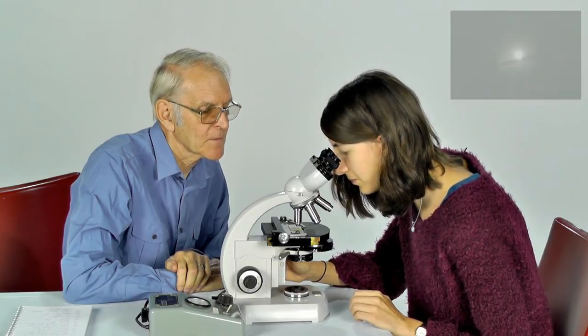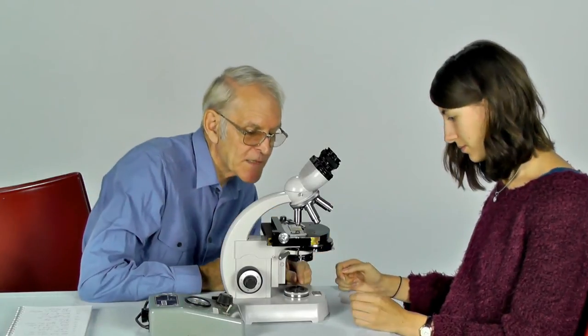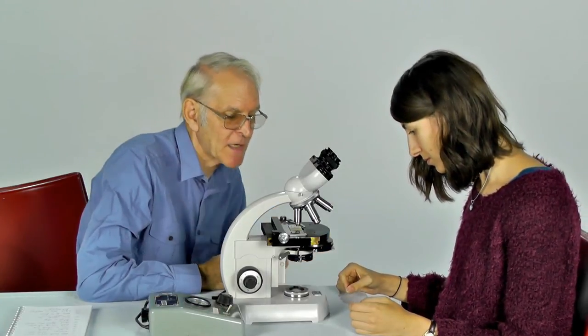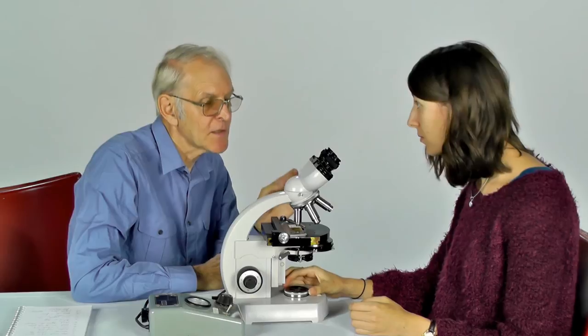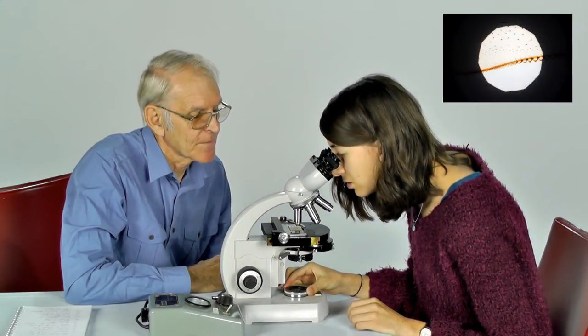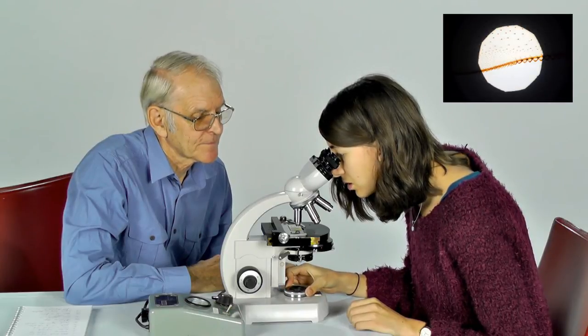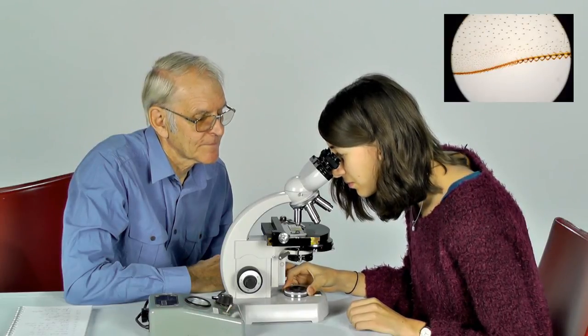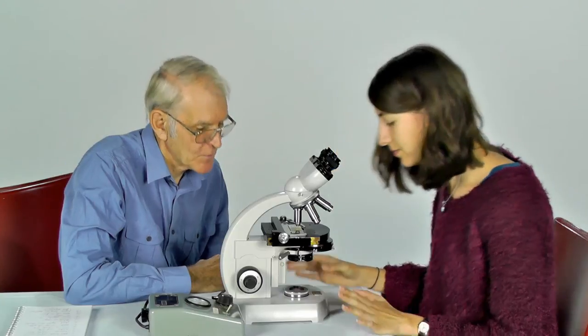Now it's a matter of opening up this iris diaphragm until you just fill the field of view with light. Okay. Well done.